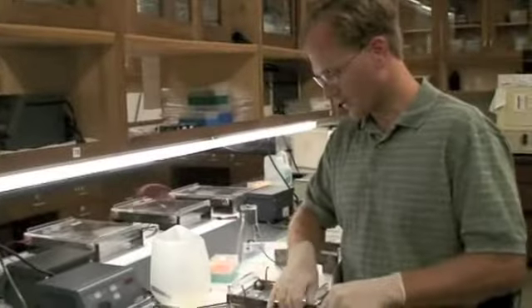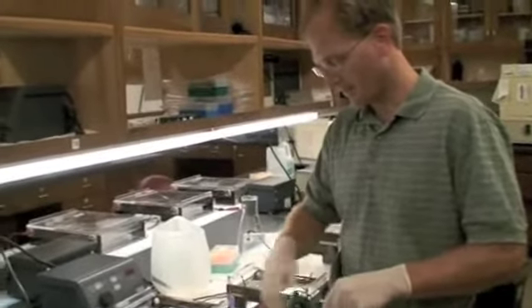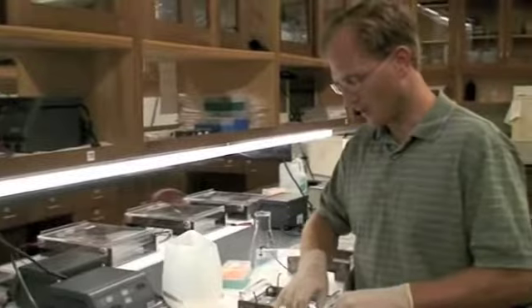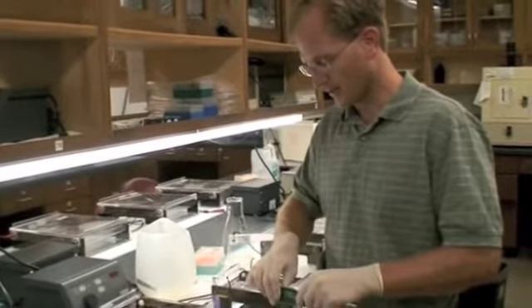The reason why I do the ladder first is this is my standard. I want to make sure that everything in my samples runs well.